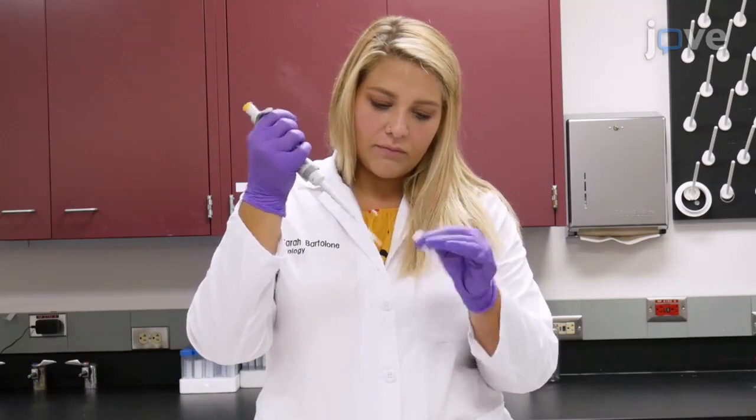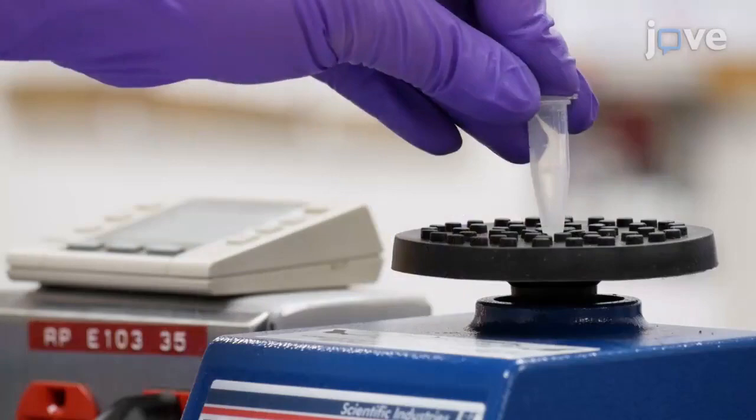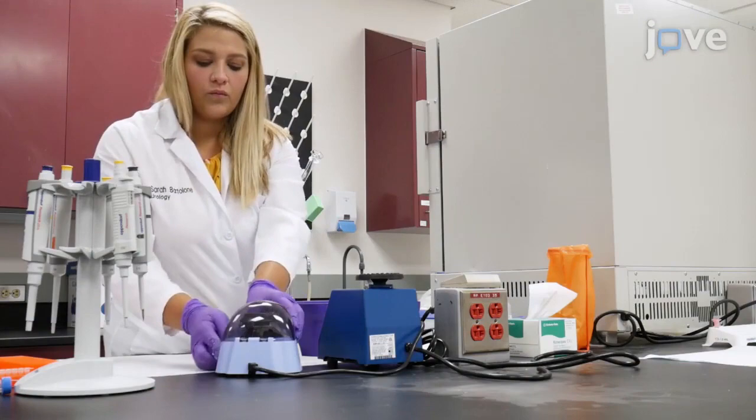Prepare a 10x RT-LAMP primer mix as outlined in Table 2 of the text protocol. Vortex briefly to ensure homogeneity and centrifuge briefly at maximum speed to avoid any loss. Store the primers at minus 20 degrees Celsius between uses, avoiding any freeze-thaw cycles.